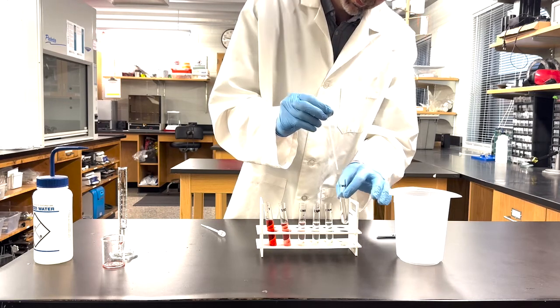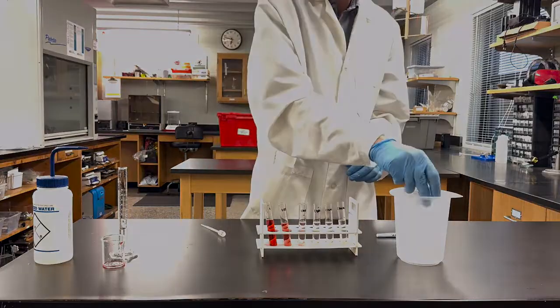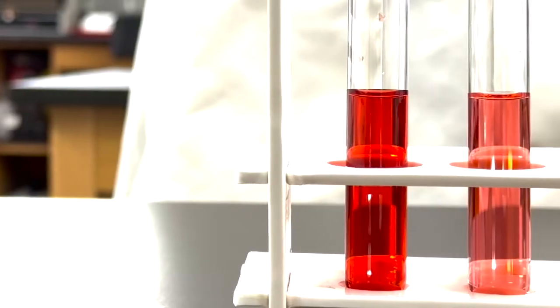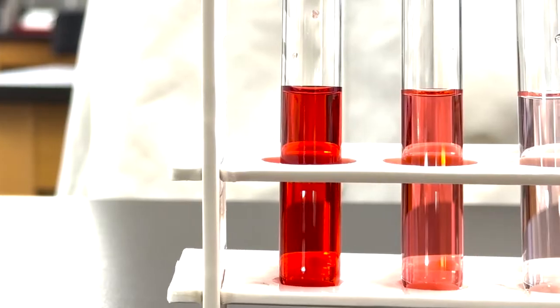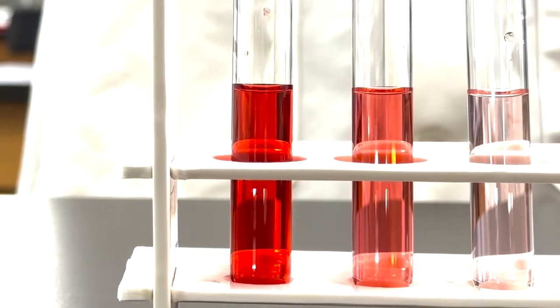Remove 1 mL from the final tube and dispose of it so that all tubes have the same volume. The series is now ready to be used in its intended application.